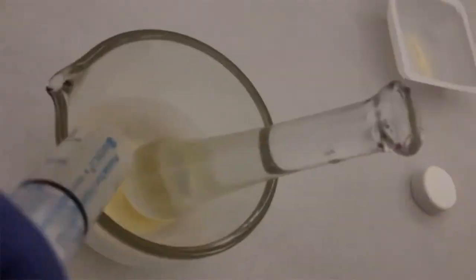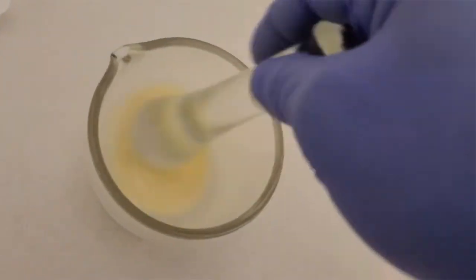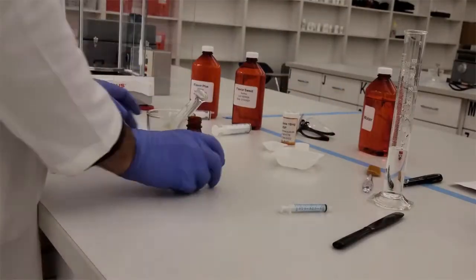Once I've got it nice and smooth paste, I'm going to add a little more of the suspending agent, a little bit more, and I'm going to incrementally add that suspending agent until that whole volume, which is 50% of the volume I need in my final compounded preparation into there.